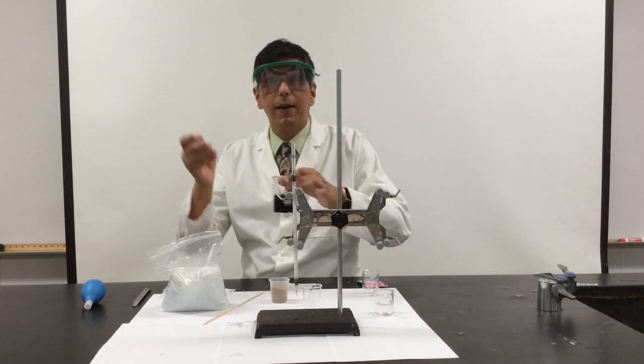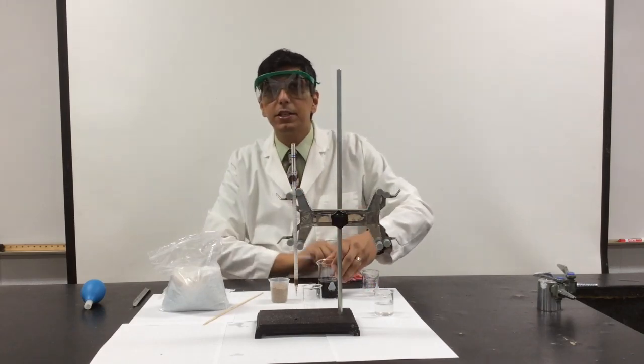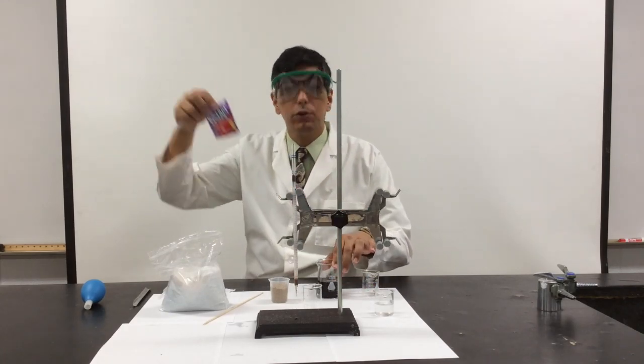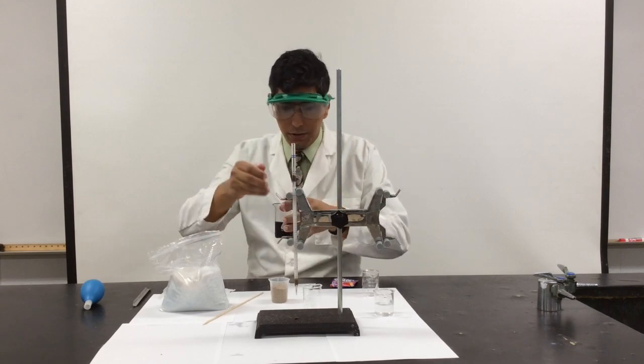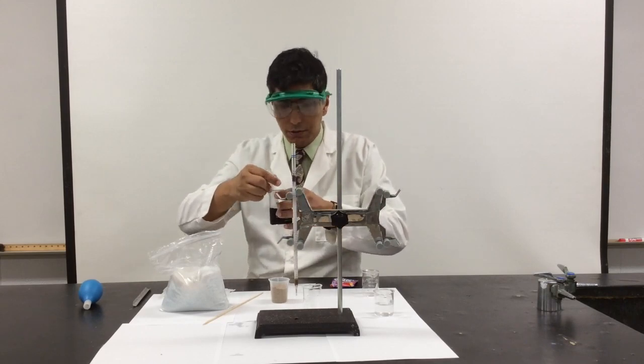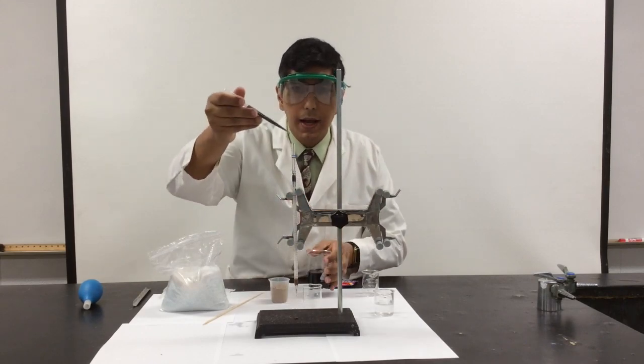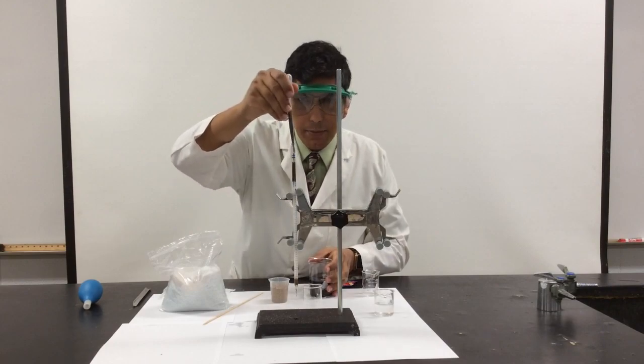I'm going to add the solution. Here I have the grape Kool-Aid. I just mixed this by adding some grape Kool-Aid crystals to some distilled water. I did not add any sugar. And I'm going to add that to the top.